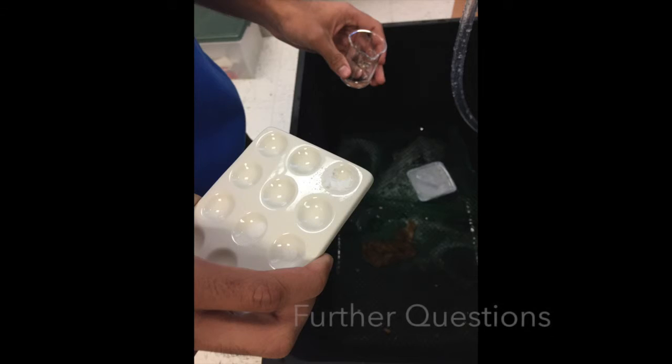We have potential further questions about this lab. We tried to conduct an anion test, but it failed. There are no observable changes in the color of the substance. Therefore, the test couldn't be narrowed down to search results. It wasn't mentioned in the other part of this video because it wasn't useful in finding the names of the unknown substances.